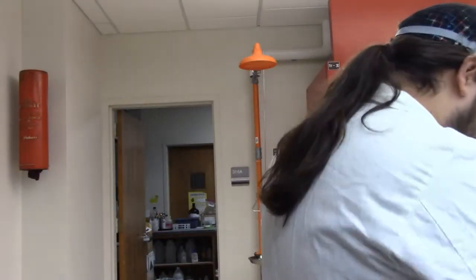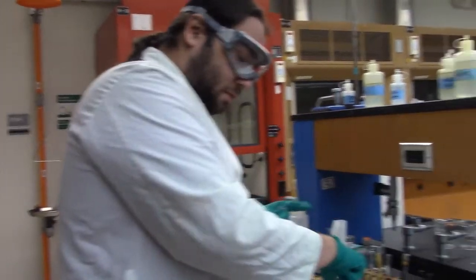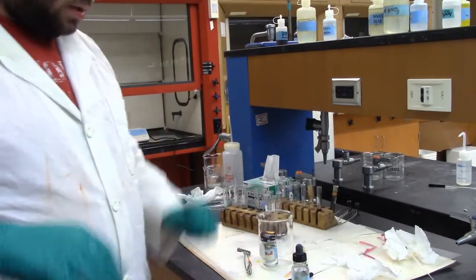So, you guys tell me if we found some cobalt or not. And with that, we have finished our group 3s, and in a moment we will do the group 4s.